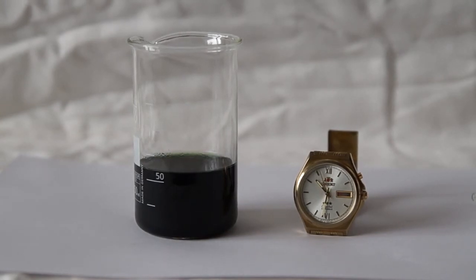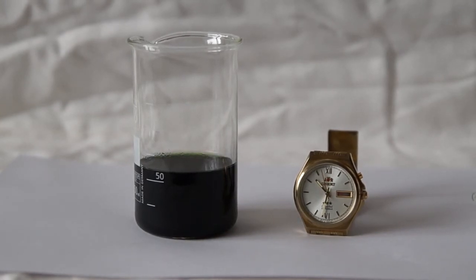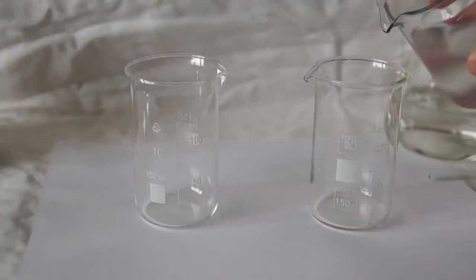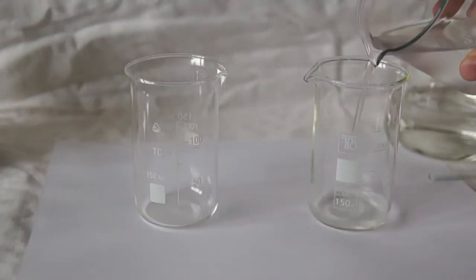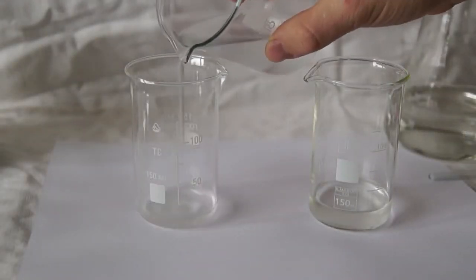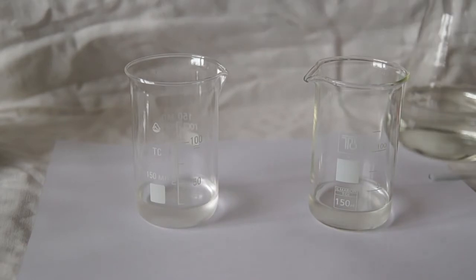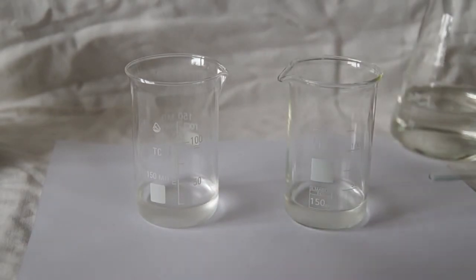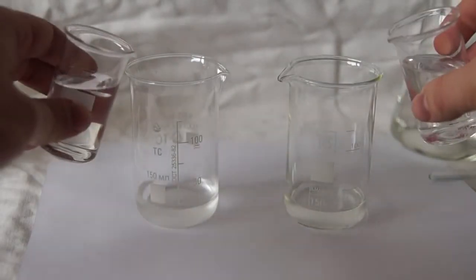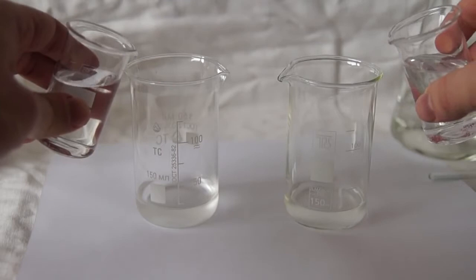The color change is the reaction between iodine and starch — starch acts as an indicator of iodine. Now take two beakers of the first working solution. However, the second solution is at a different concentration, so the reaction time can change.